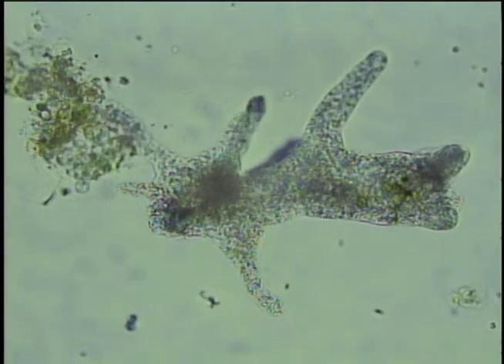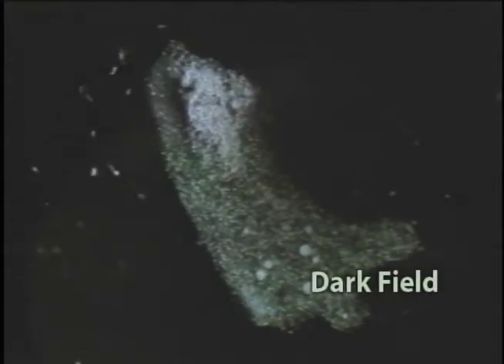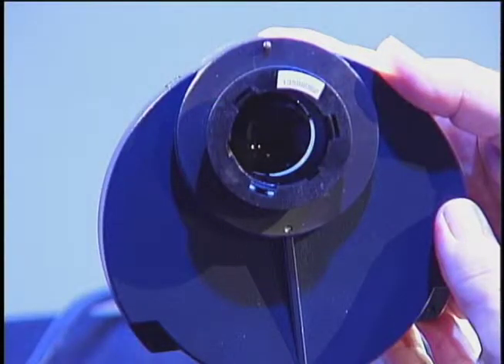Additional internal structures of the amoeba may be visualized by using the second method, called dark field microscopy. As the name suggests, you now see the specimen as a bright object against a dark background. In dark field, an opaque disc is placed underneath the condenser lens so that only light that is scattered by objects on the slide can reach the eye. Instead of coming up through the specimen, the light is reflected by particles on the slide.